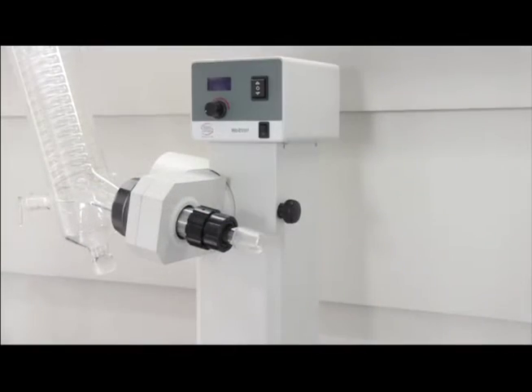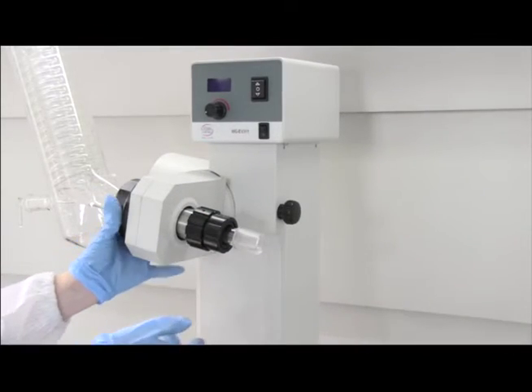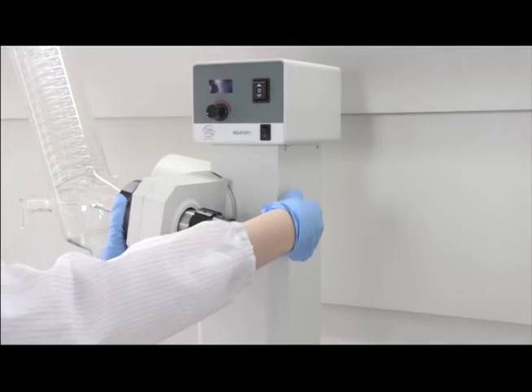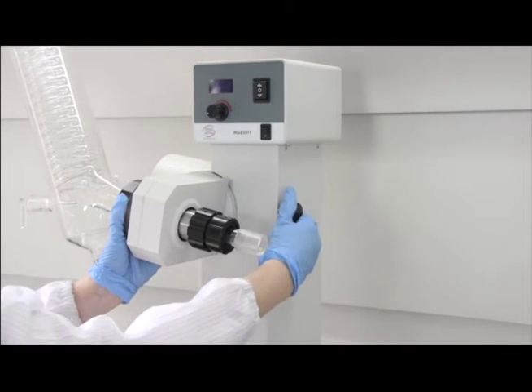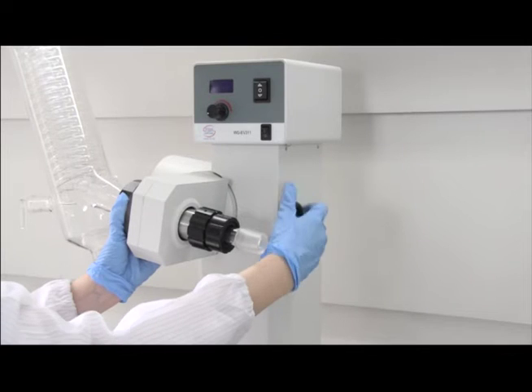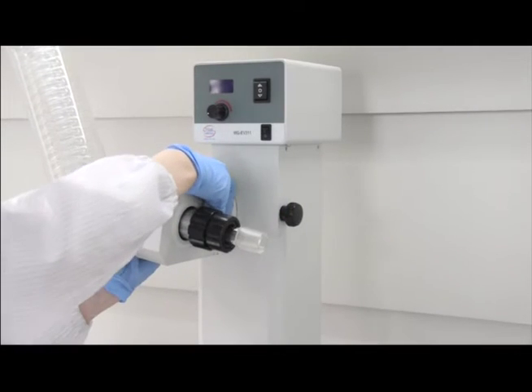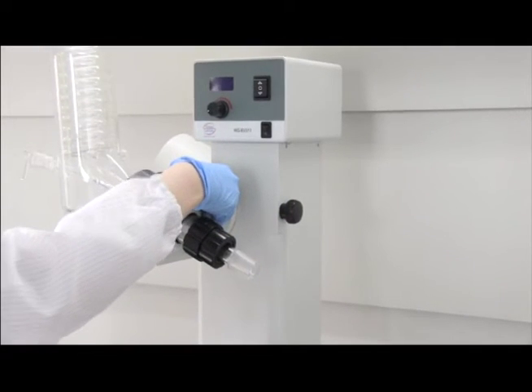Now we need to adjust the angle of the condenser so it is vertical. First, loosen the motor locking knob by rotating it towards you, then rotate the condenser until it is vertical.